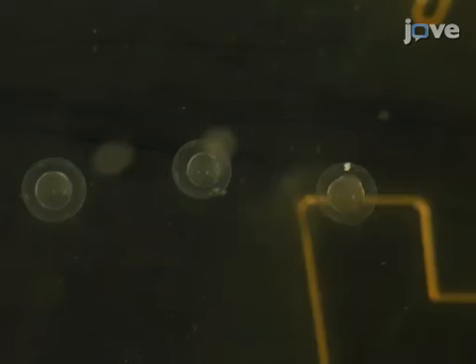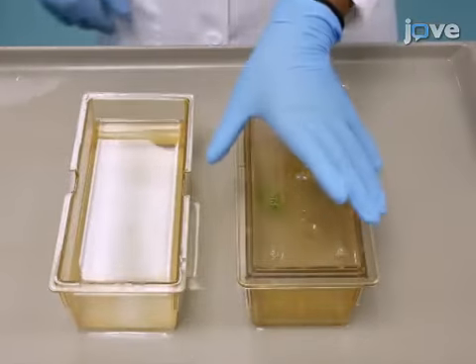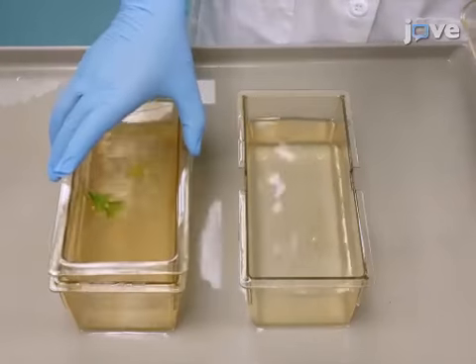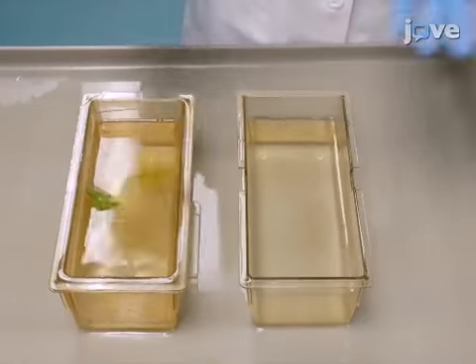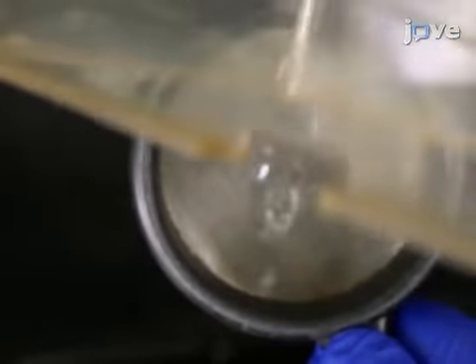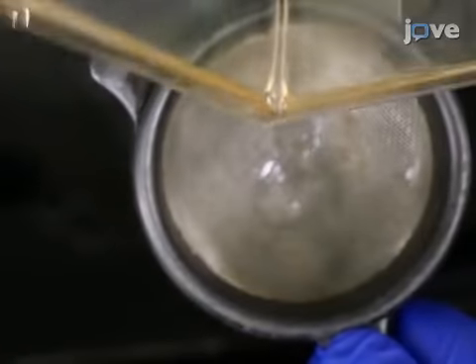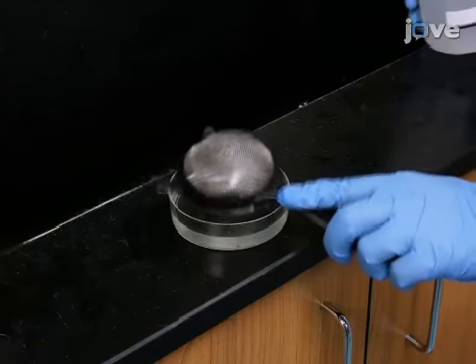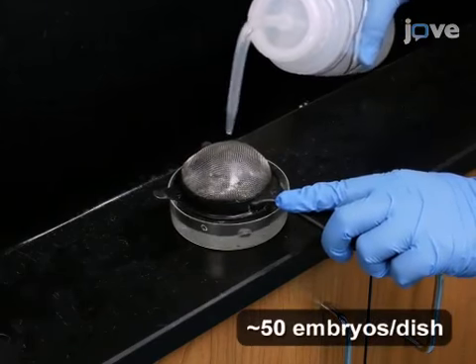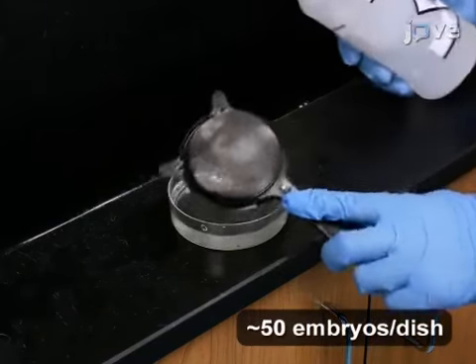The embryos will be at the bottom of the breeding tank. When eggs are observed, lift the slotted inner tank out along with the fish and quickly place them into a clean solid outer tank filled with RO water. Use an egg collecting screen to collect eggs from the outer tank and transfer the eggs to petri dishes containing 30 milliliters of 1x embryo medium. Incubate the collected eggs at 28.5 degrees Celsius.